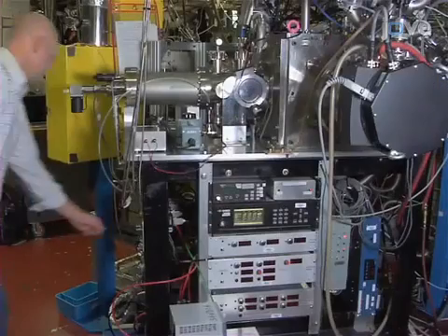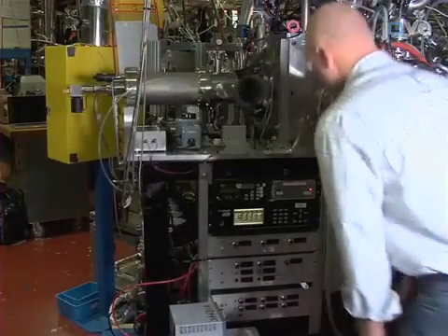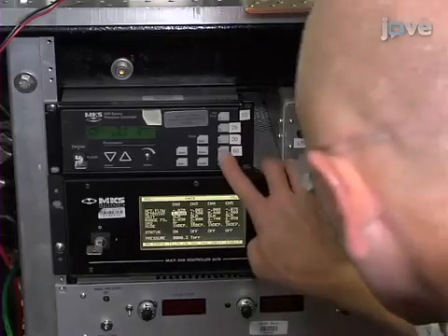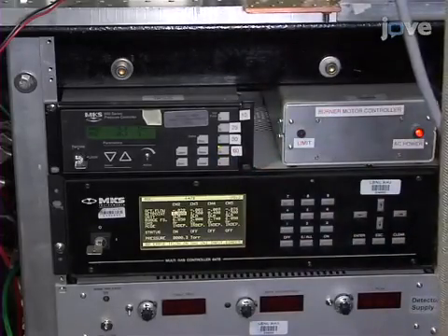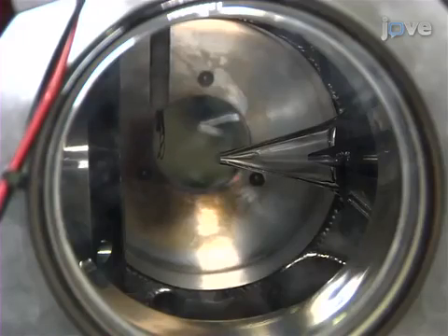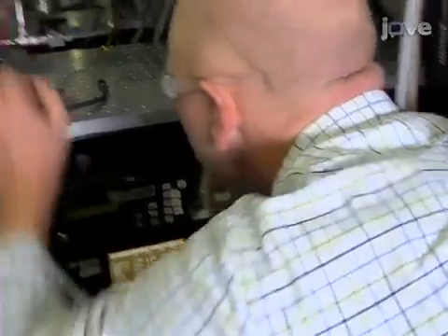First, establish a 1 liter per minute flow of argon and a 1.5 liter per minute flow of oxygen through the burner surface and maintain a pressure of 80 millibars in the flame chamber. Position the hot wire igniter over the burner surface. Then set the hydrogen flow to 0.4 liters per minute and quickly activate the igniter.